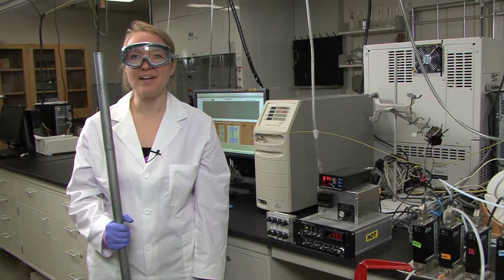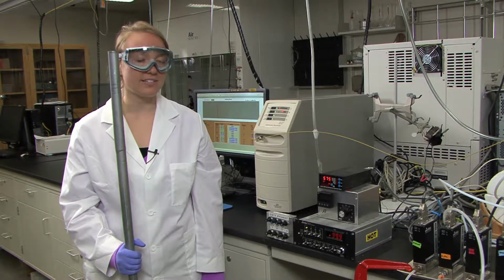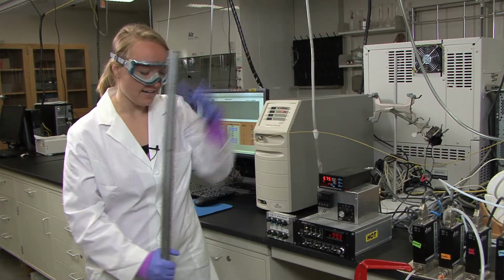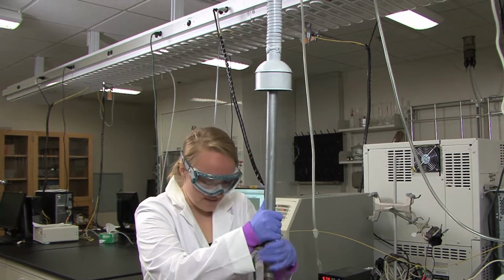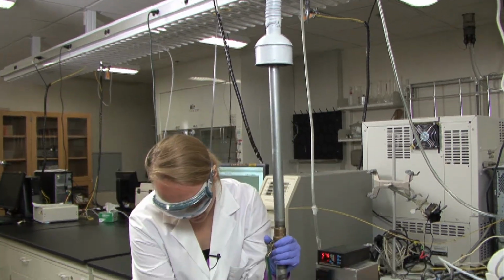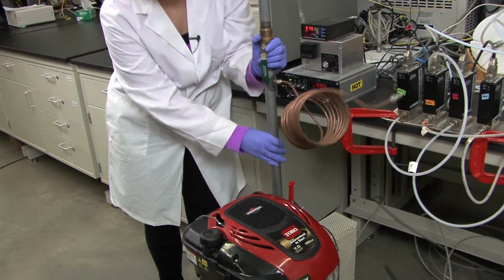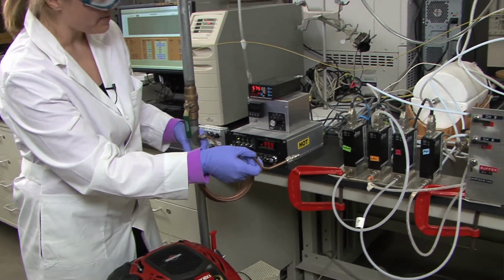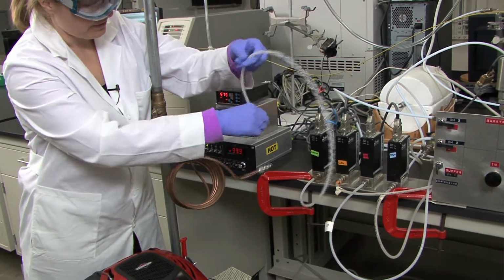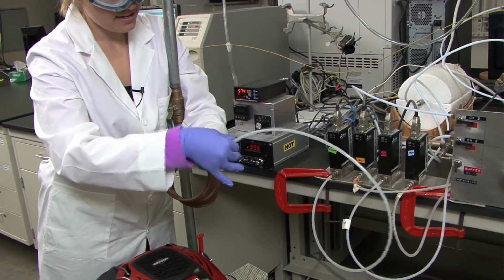So when the students get to lab, you'll get out the lawnmower, and then the first thing you need to do is connect the lawnmower exhaust to the vent outside. So to do that, you'll want to put this pipe up there and then connect it to the exhaust. And then you need to connect this exhaust pipe to the gas manifold. So you will connect this and screw it on.